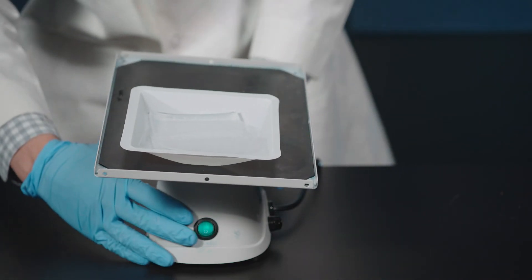Move gel onto a white light box and turn on to view the bands on the gel.